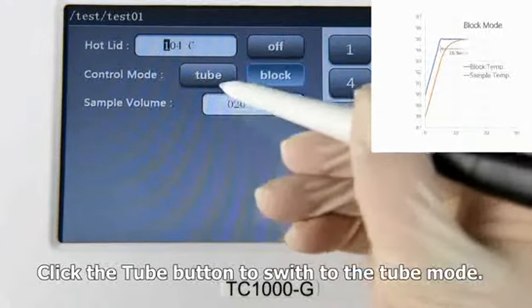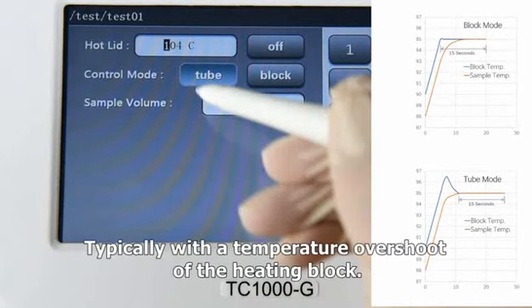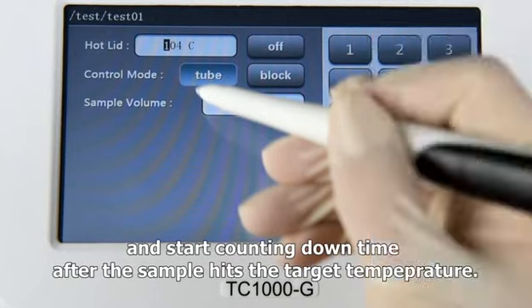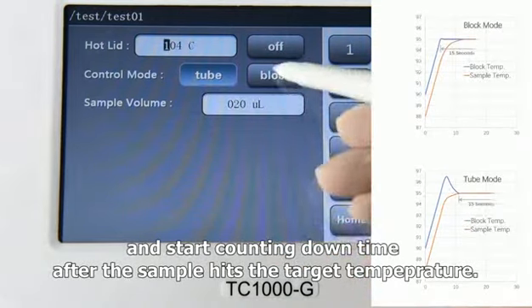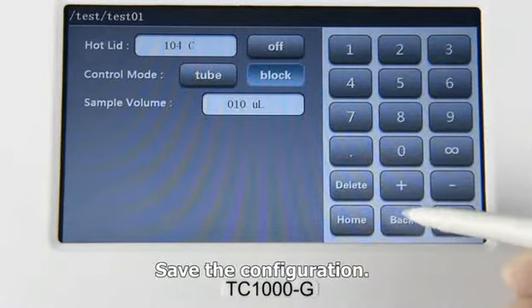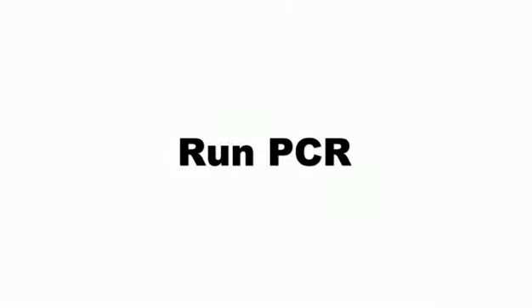Click the tube button to switch to tube mode, which estimates the temperature inside the tube, typically with the temperature overshoot of the heating block, and start counting down time after the sample hits the target temperature. Set the actual sample volume. Save the configuration. Save the program. Run PCR.